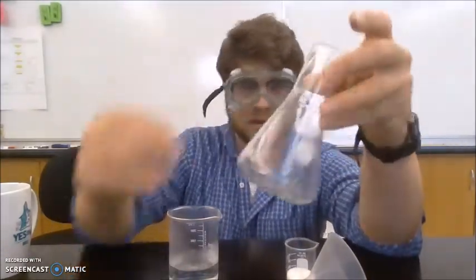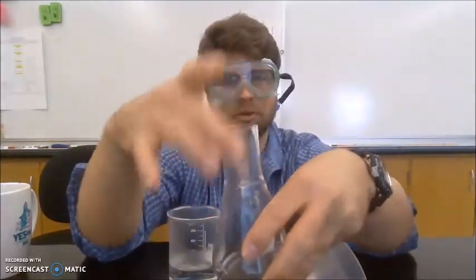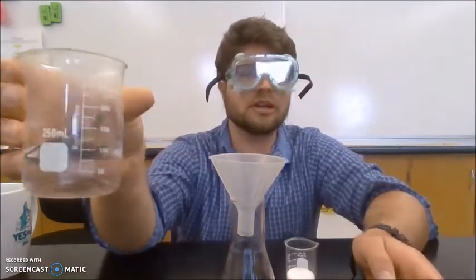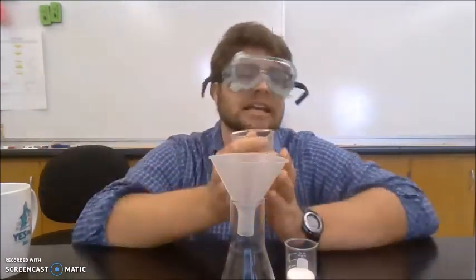Hi, class. Right now, I am going to show you some yeast fermentation in action. I have an Erlenmeyer flask. An Erlenmeyer flask has a wide bottom, and then it slopes up to the top, and then there's a neck. So I'm going to add a funnel to make sure everything goes in the flask and doesn't get everywhere. I have 100 milliliters of water. I've microwaved it for 30 seconds to make it warm to the touch.